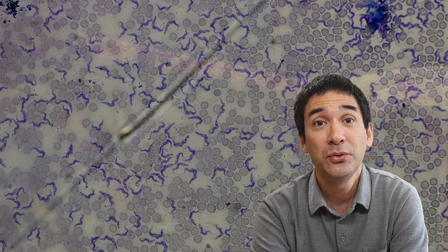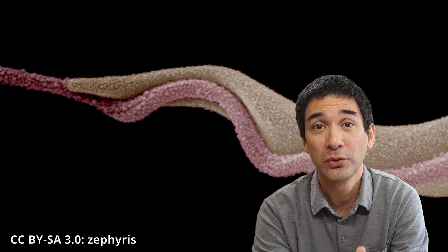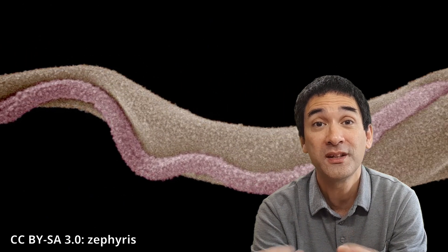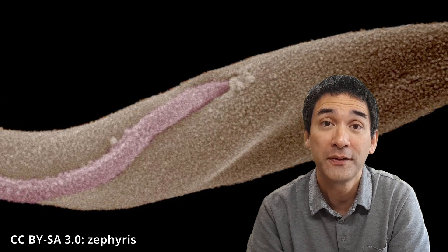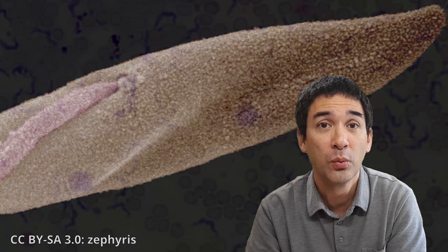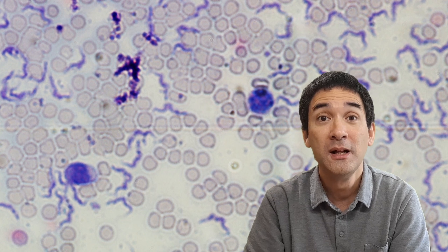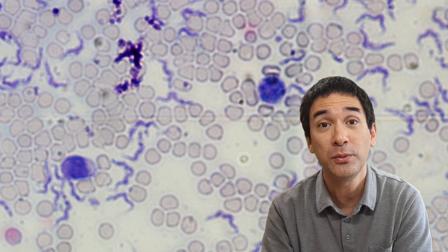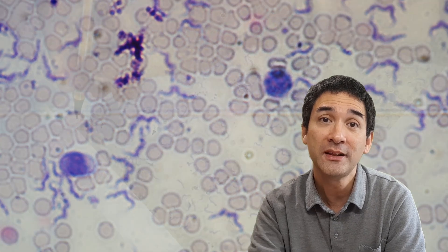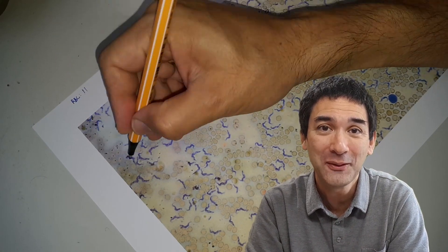I don't know if they actually grew them in the blood sample to make the microscope slide, or whether this is blood directly taken from a person. But if this really were the number of parasites inside a person's blood, then this is a very high number. For this reason I decided I just want to determine the ratio between those parasites and the red blood cells, so I made a printout and started to count them.